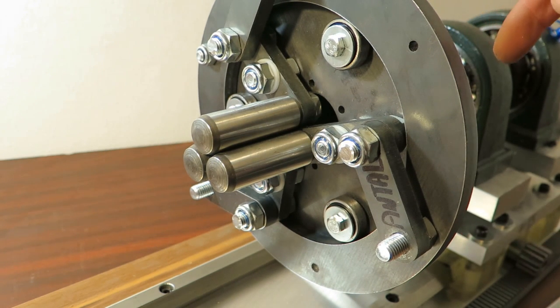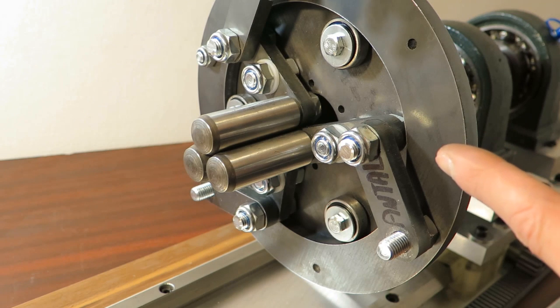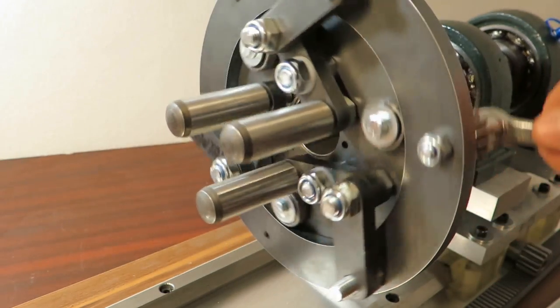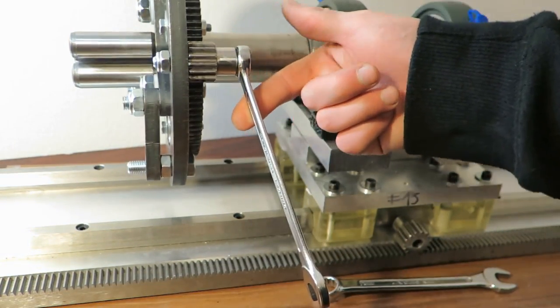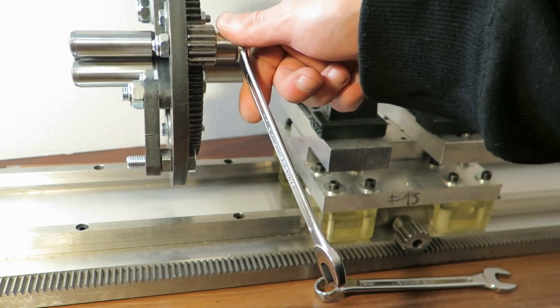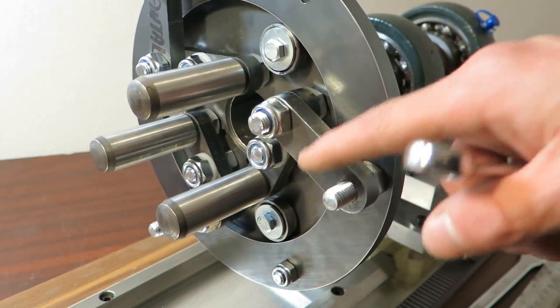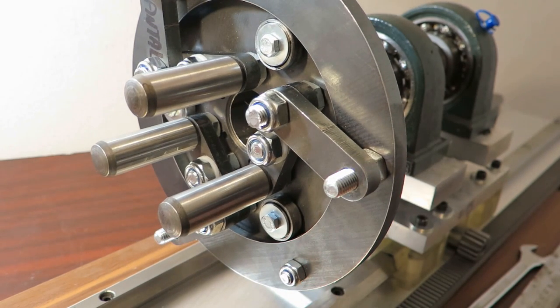I was thinking about some Teflon spacers, well, right now I have a nut there. And I was thinking about some Teflon spacers that will provide low friction, but they are soft, so it will be able to bend, and that's not good. But yeah, I'm quite happy. Basically, if I can show you, I'm holding this, well, what's that, 40 millimeters, that's about 1.25 of an inch, and I'm still able to move that, basically. Also there is no nut, because this is held by this screw, and it has quite a bit of play, but it's doing its job, basically.